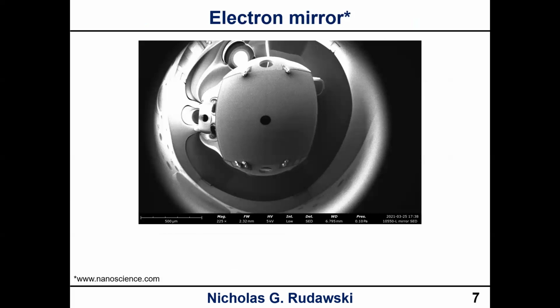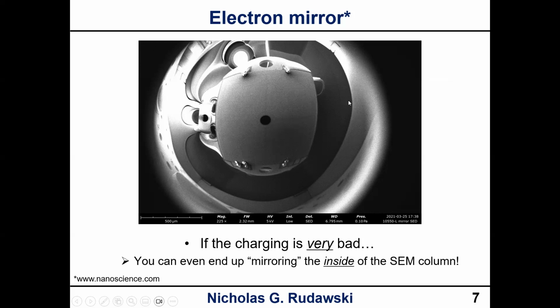Okay, and then if you have a really bad issue with charging, you can end up with what's called an electron mirror. Literally, your sample accumulates so much charge that your electrons deflect right off of it and never actually make it to the sample, and they end up imaging the inside of the microscope chamber itself. What you're actually seeing here is the BSE detector that's right under the pole piece right here, and then this is the surrounding area of the chamber. This is the worst case scenario, right? This would be like if you were imaging an uncoated piece of glass. That would be a perfect example of what could happen, okay?